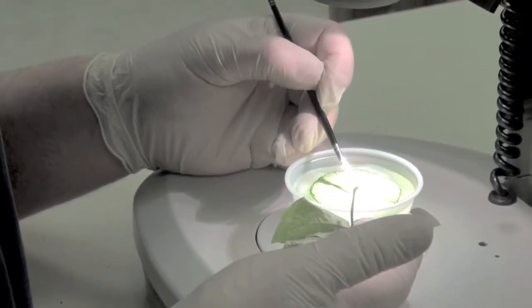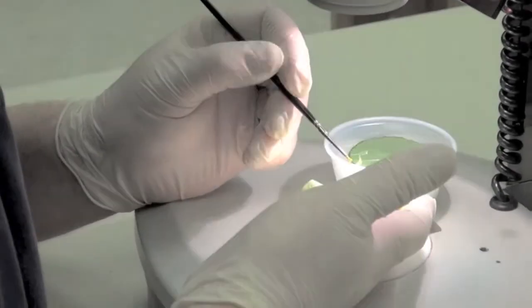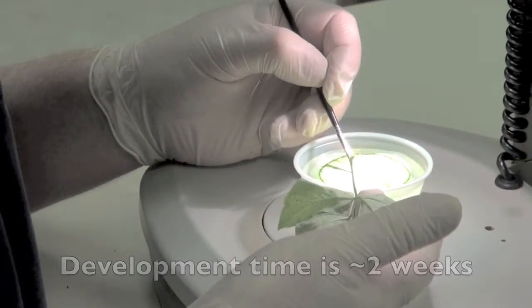At the beginning of the first week, adult female mites are transferred onto the leaf discs and allowed to lay eggs for 24 hours. As these eggs hatch and develop, they will become your adult female group of a known age.